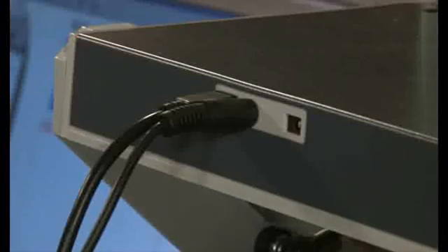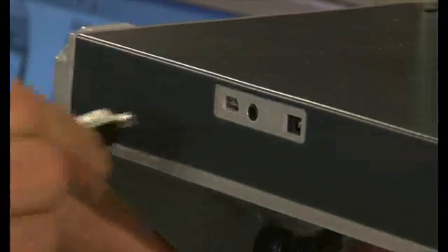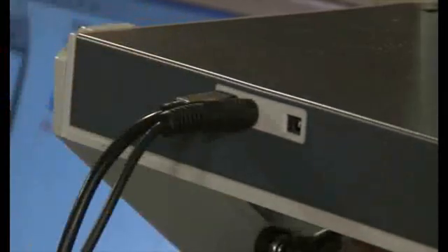Use the included communication cable to attach the smart stand to your analyzer. Insert one end of the cable into the COM port on your smart stand and the other end to the appropriate port on your instrument. By connecting the smart stand, your analyzer knows whether the protective lid is open or closed, and thus whether it is safe to initiate a test. Plug the USB cable into your computer's open USB port. Plug the other end into the smart stand's USB port. The smart stand will draw the operating power that it needs from your computer.